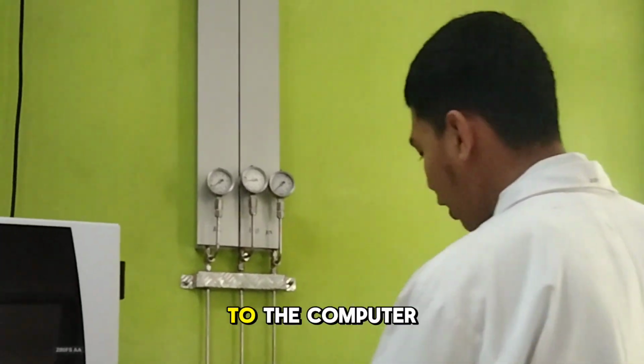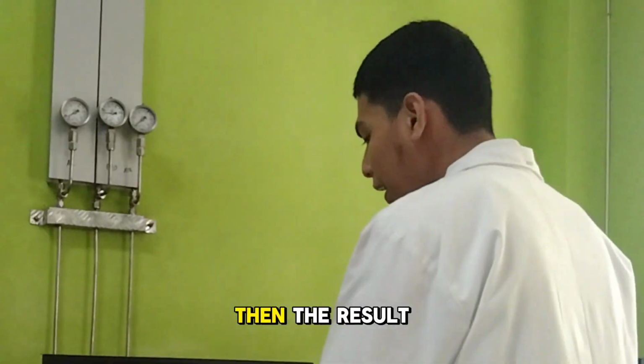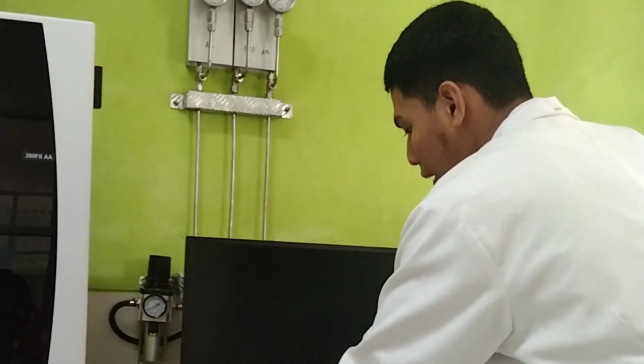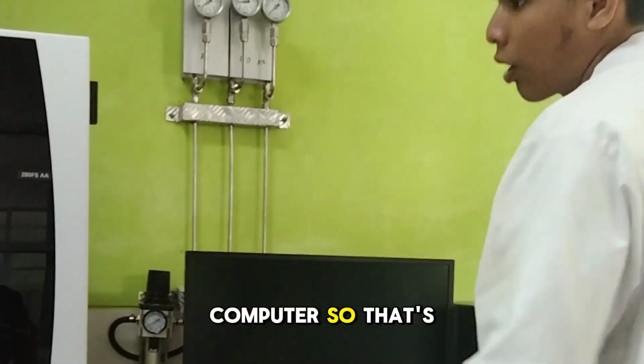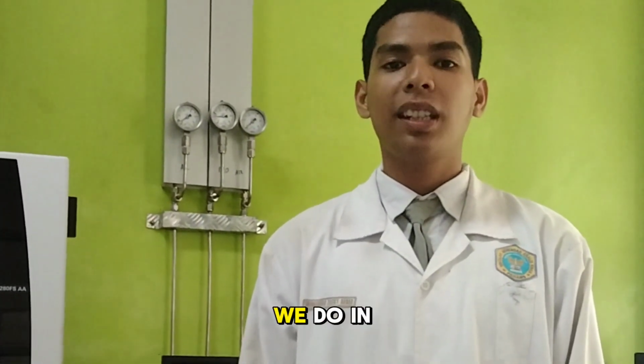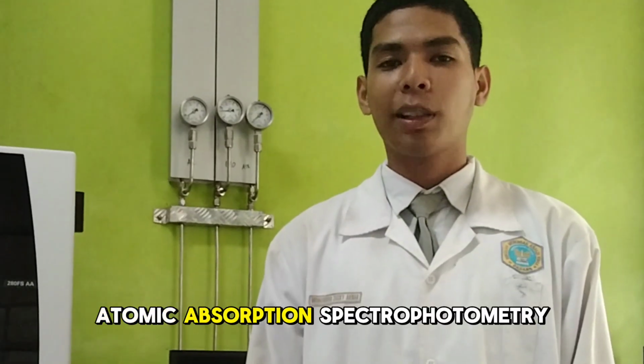Let's change to the computer that connects with the tool. The result of the analysis will be displayed on your computer. So that's all the practicum we do in atomic absorption spectrophotometry.